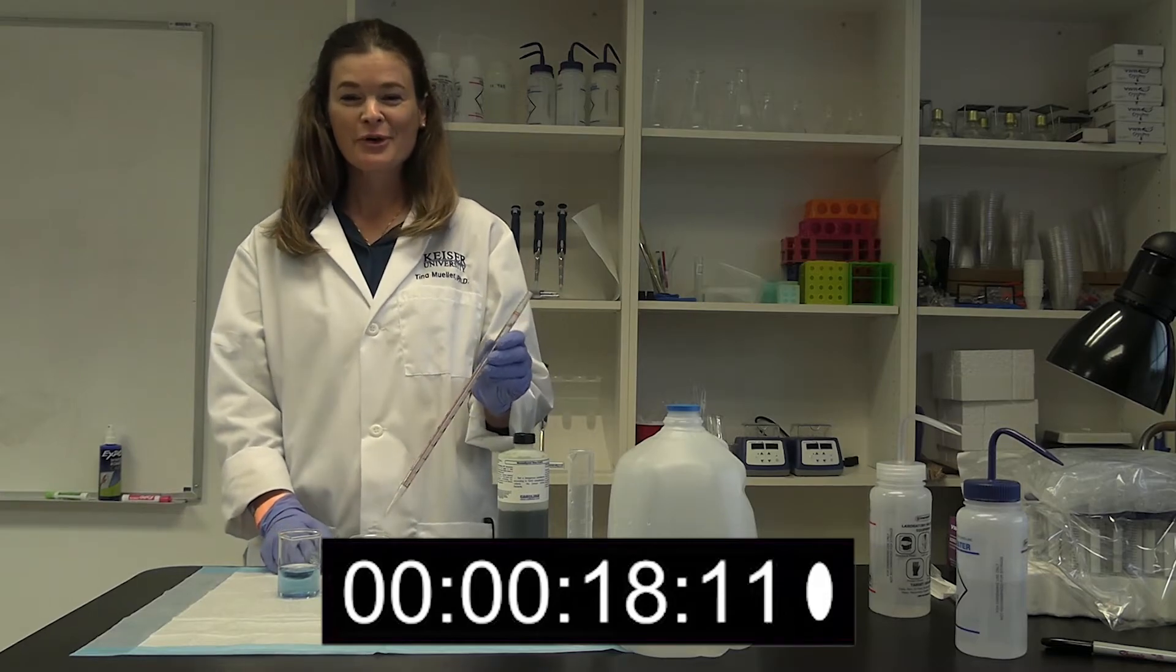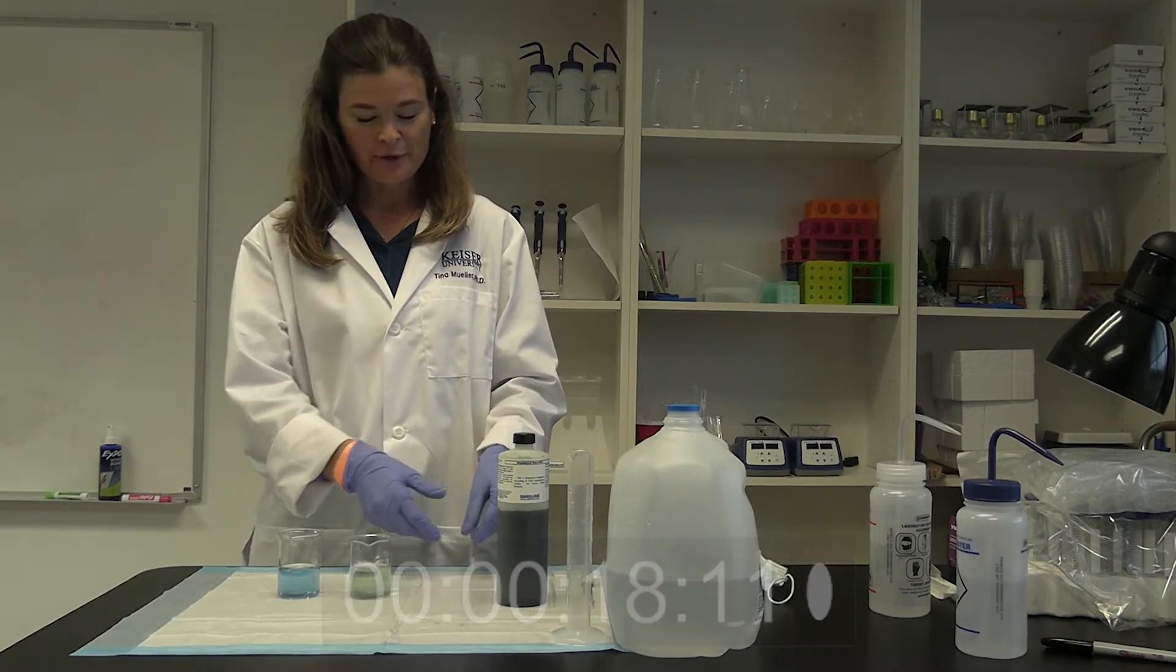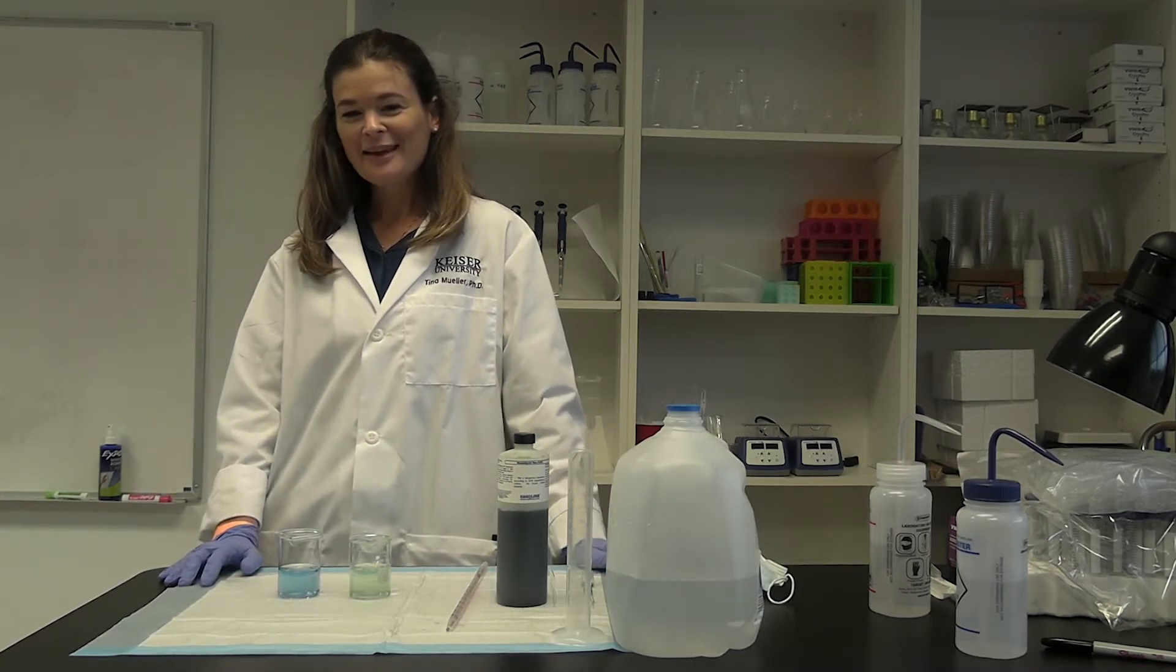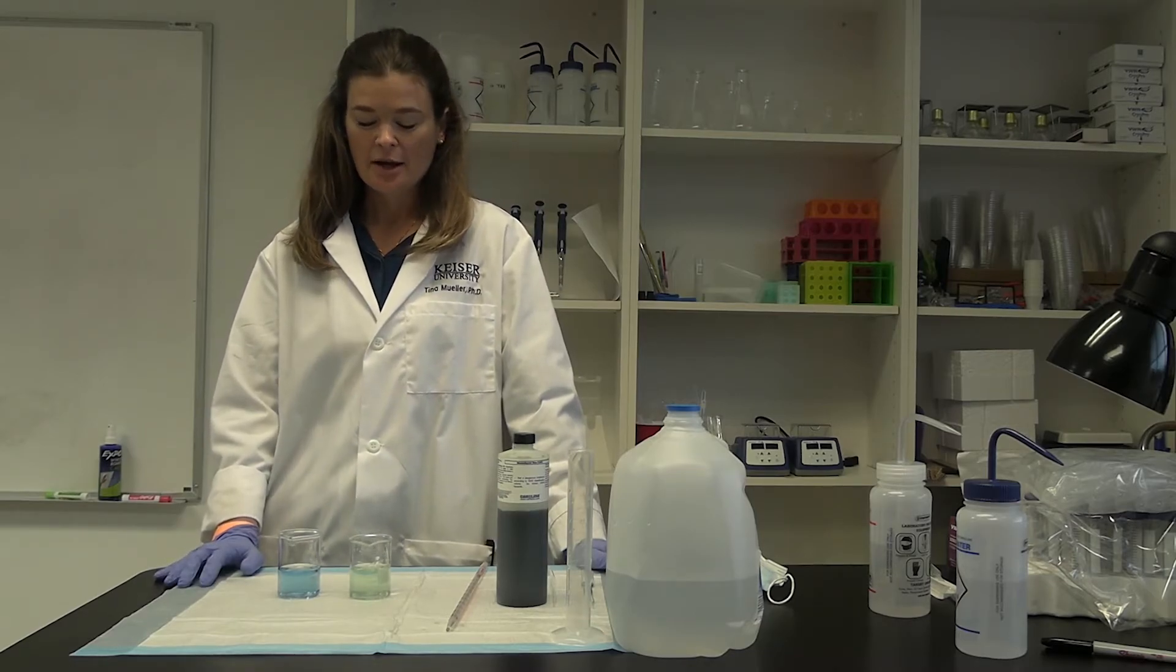I guess we are there. Okay, this is the first part of the experiment.